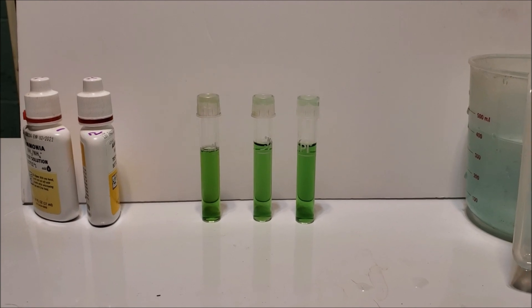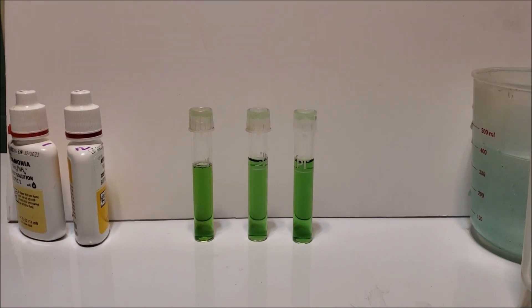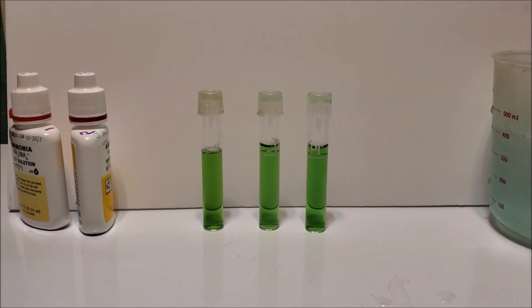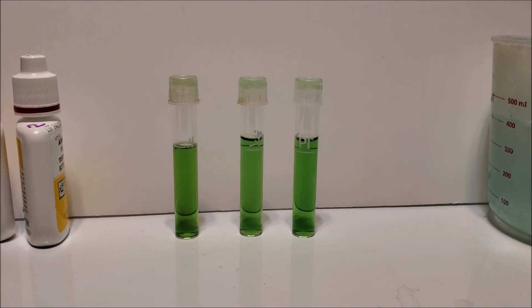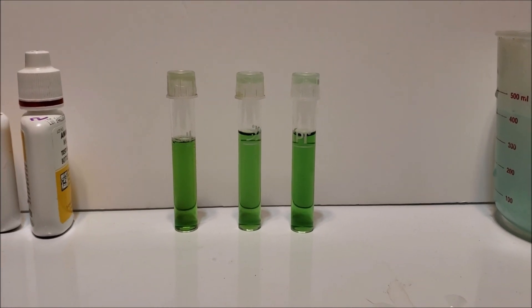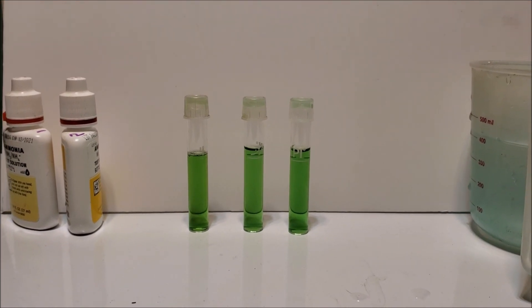And I would also imagine that if you did four drops of one and four drops of two, you'd probably still get the same color from one vial to the next. But it would just be lower, it wouldn't match your color scale. So that's why you do the eight drops. That's what it's measured out to be. And you get the accurate result.